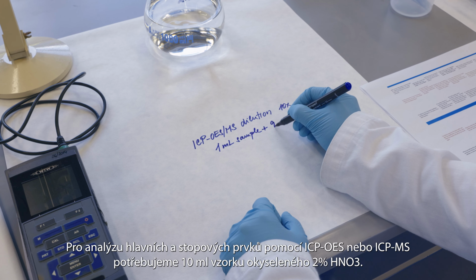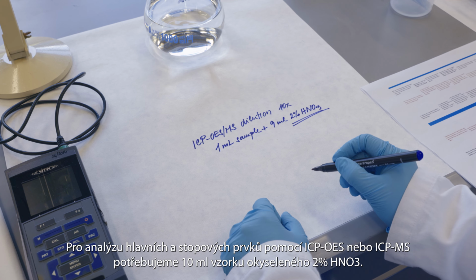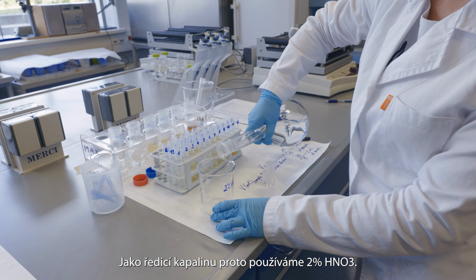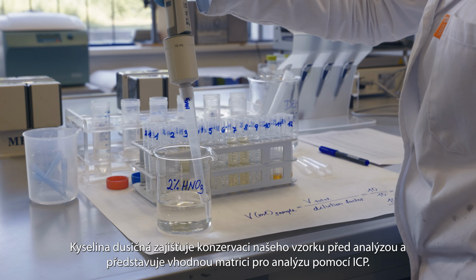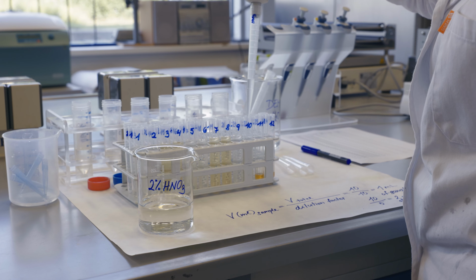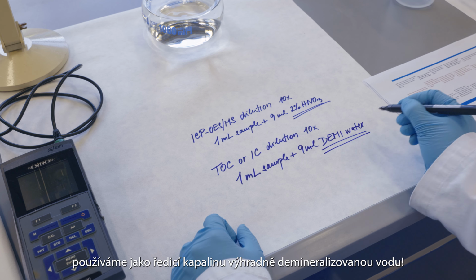For major and trace elemental analysis using ICP-OES or ICP-MS, we need 10 milliliters of sample acidified with 2% nitric acid. Therefore, we use 2% nitric acid as the diluent. Nitric acid provides preservation of our sample prior to analysis and is a suitable matrix for ICP analysis. For the anion analysis by ion or liquid chromatography and for the dissolved carbon analysis, we use exclusively demineralized water as the dilution liquid.